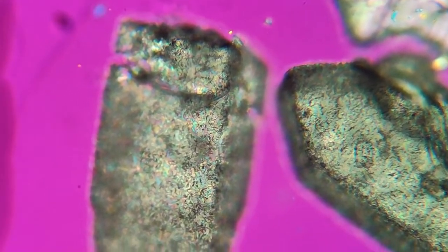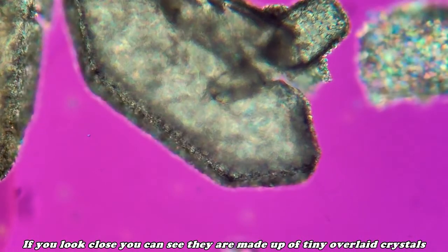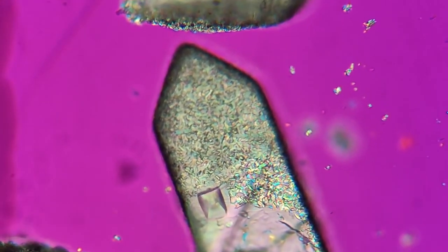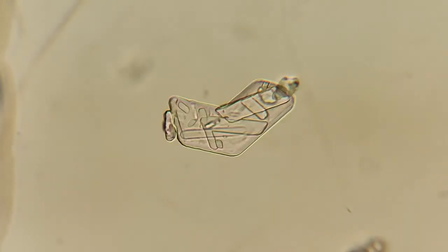One of the key features of this mineral is its perfect cleavage, which, unlike calcite, will tend to give you an elongated hexagonal crystal. Due to the mineral's hardness, which is down around 2.5, the surface of nahcolite can appear grainy. Undamaged or newly formed crystals will have a very smooth, elongated shape.